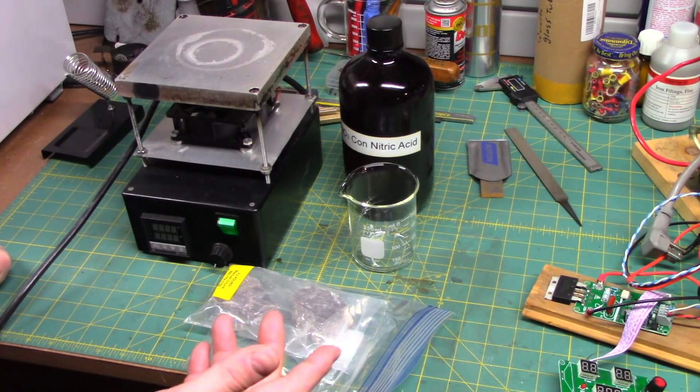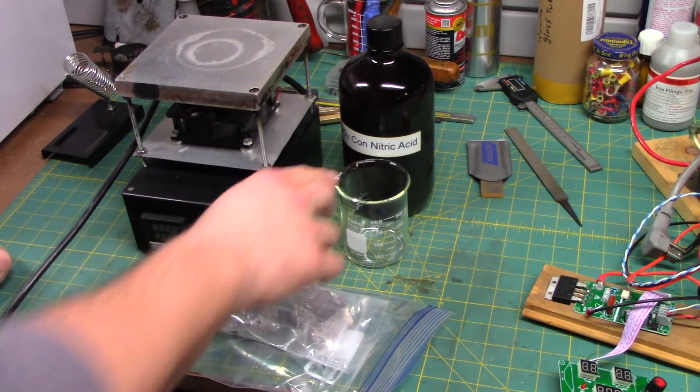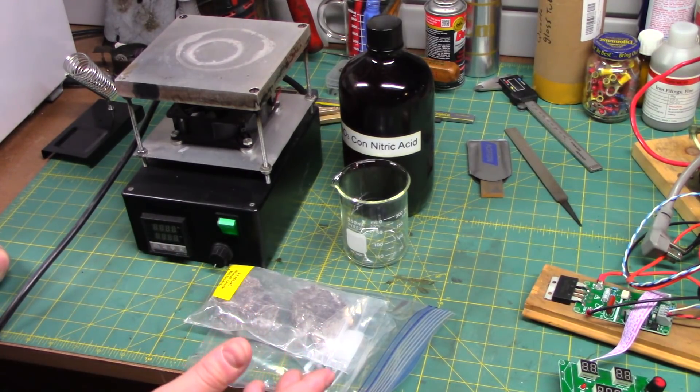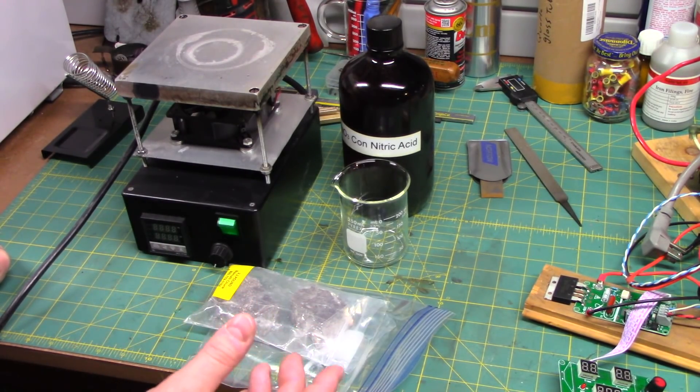Now the trick is, that involves pretty high temperatures, higher than you can go in borosilicate. And I don't have any ceramic crucibles right now. I'm fresh out. So, we're going to try something a little different.